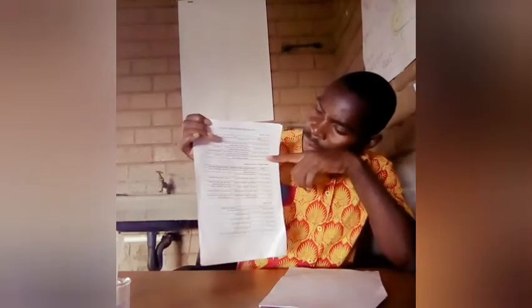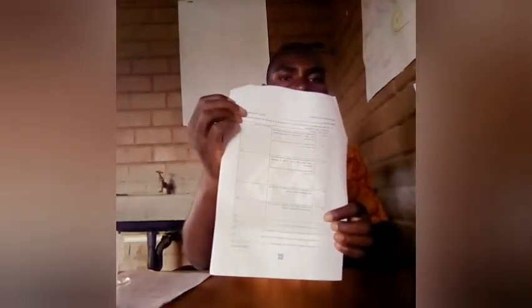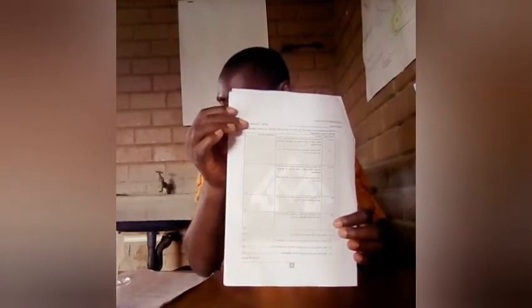This white precipitate is an identification of the anion present. Where there's a white precipitate, it is barium nitrate, and this is test D. That's the test that gave us a white precipitate.